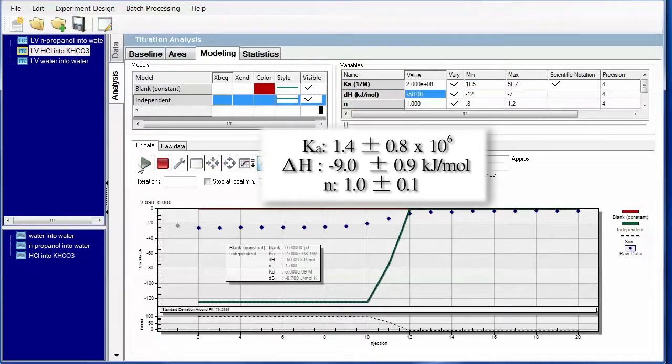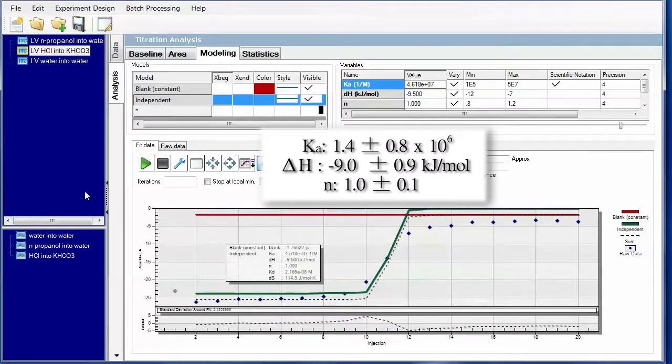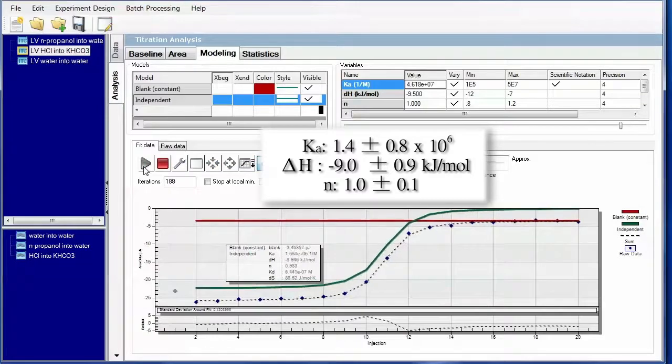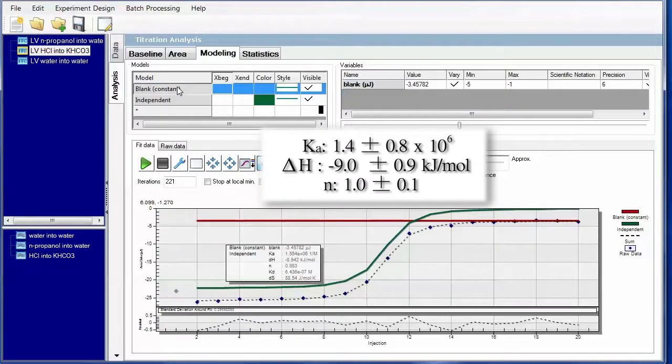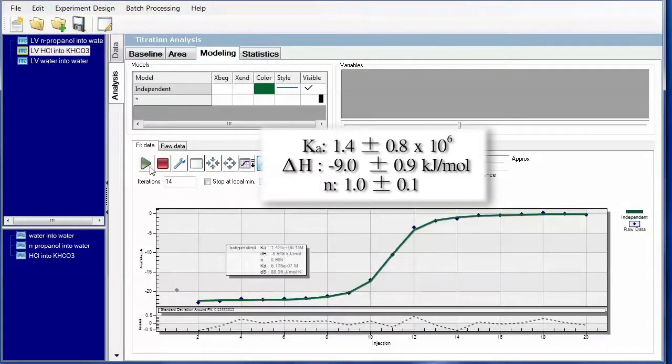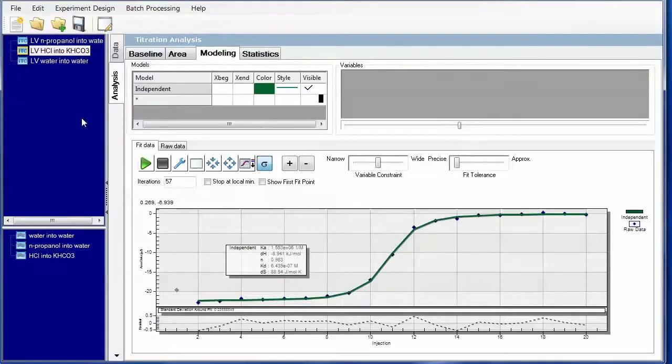Now we can go ahead and go through the fitting iteration, stop it, see how it fit. It definitely needs some more time, and we'll let it go through all by itself and come to the best fit by itself. I personally like to clean up my data after this. I take this blank constant value, -3.46. I'm going to delete that model and just enter that into the area subtract constant. And now we can refit. Data looks good. Everything fell within our expected. And we've gone through all 3 data sets for the validation kit.